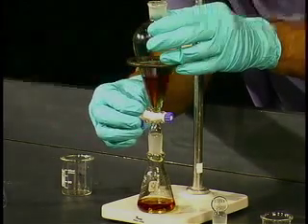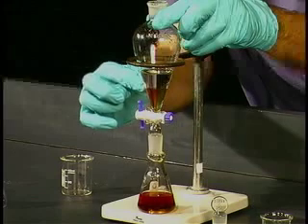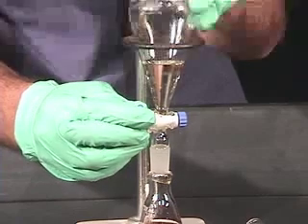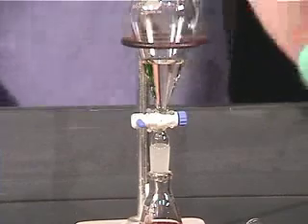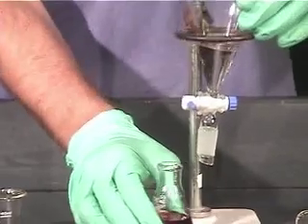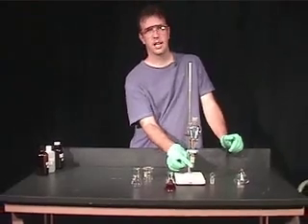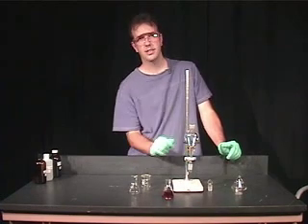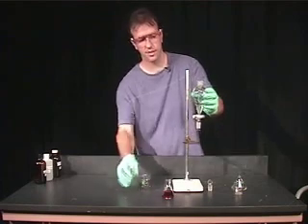The two layers are moving down, and the bottom layer will narrow until it gets to the entrance of the stopcock. At that point you want to go fairly slowly and trap that in the stopcock. Now we have our aqueous layer on the bottom. We don't want to pour the ethyl acetate through the stopcock because we would contaminate it with a little bit of water still present in the stopcock. So the top layer always goes out the top of the separatory funnel.